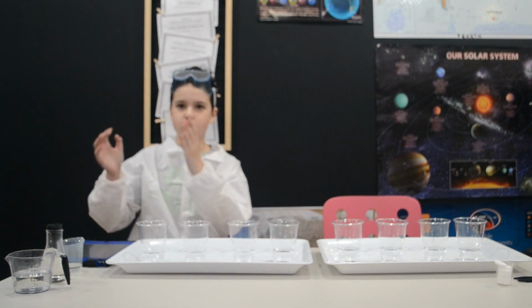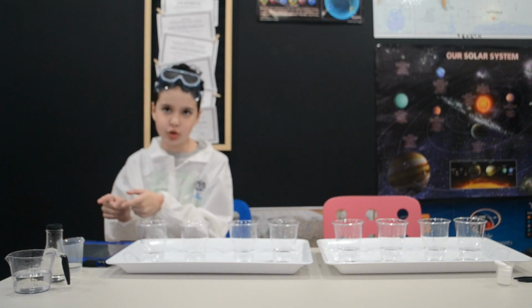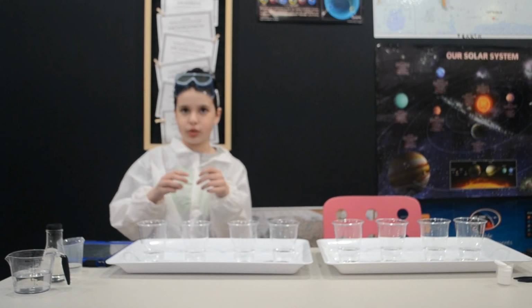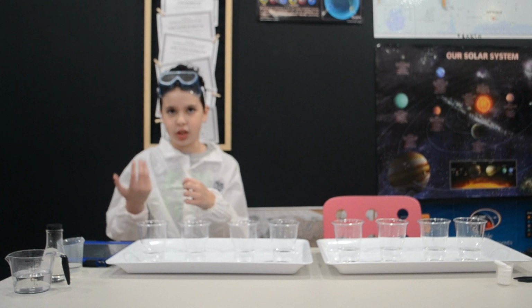And you will need a stopwatch to measure time, and you will need to weigh an Alka-Seltzer tablet so we can use that to calculate the reaction rate based off the time.